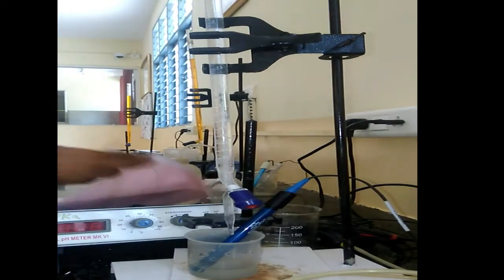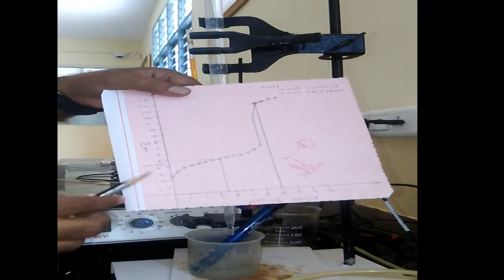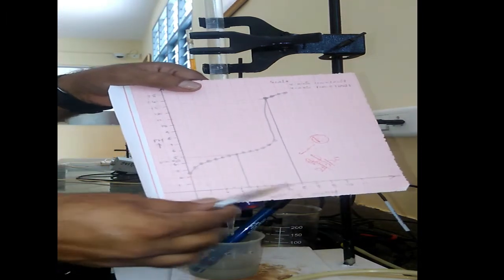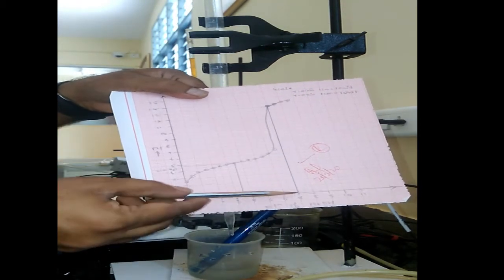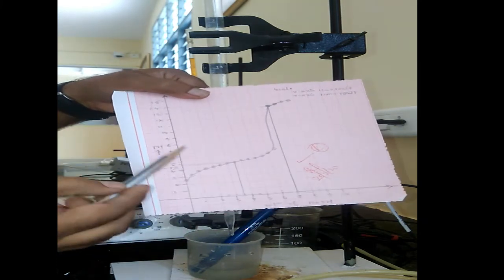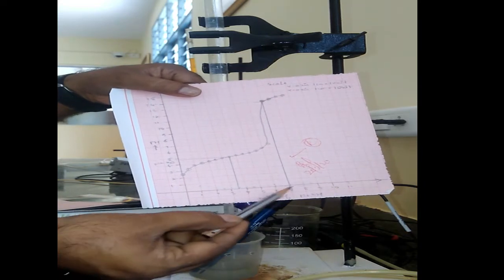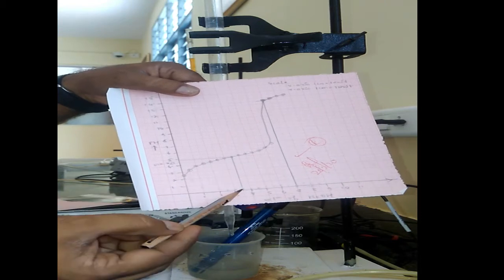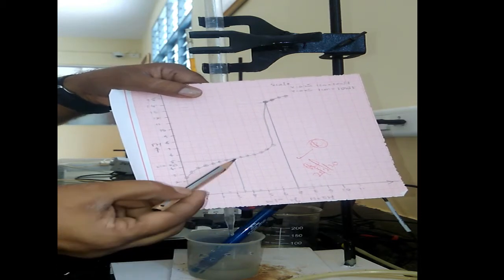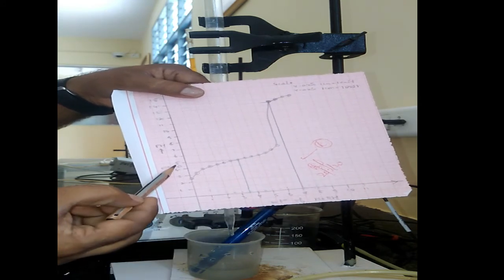In the second graph, we are going to find out the half equivalence point. This is by plotting volume of NaOH in the x-axis versus pH values directly in the y-axis. Here also we have to mark the equivalence point that is obtained in the previous graph. So let us find out the half of this. Suppose it is 5, this is 2.5. So let us draw the straight line at the 2.5 half equivalence point. Corresponding pH reading in the y-axis we have to check, because at the half equivalence point the pH becomes equal to pK according to the Henderson equation.